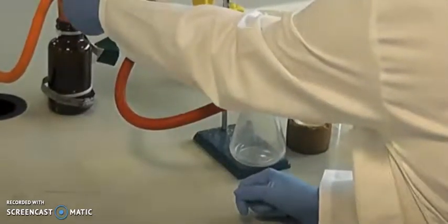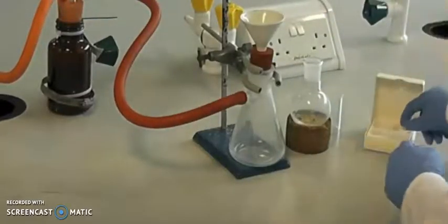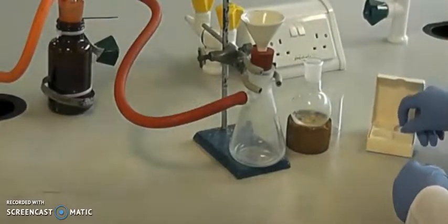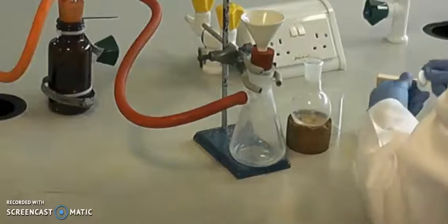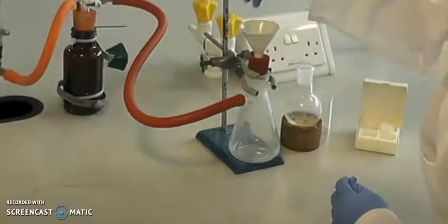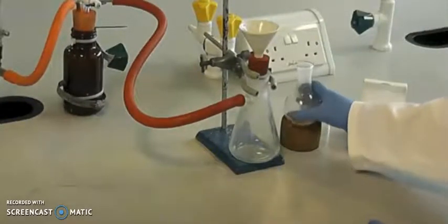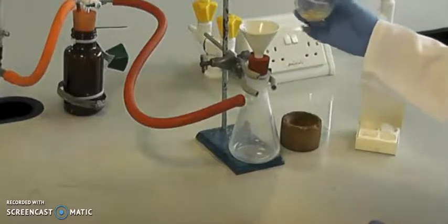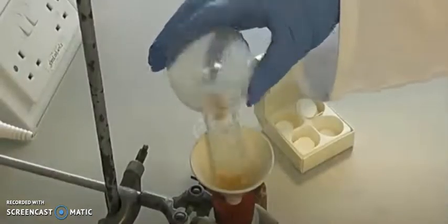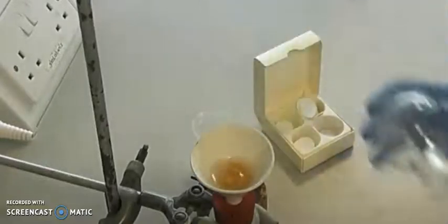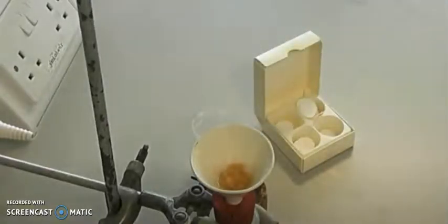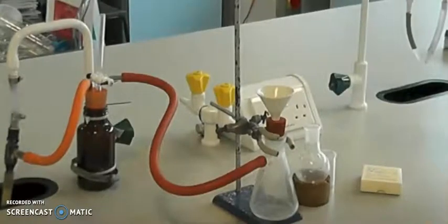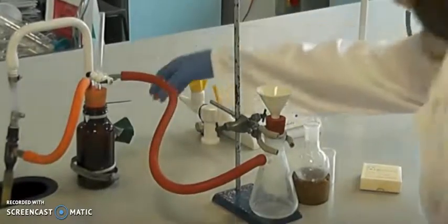Open the pressure, then put the filter paper, and then transfer. Pour the reaction mixture with the pressure. All water and any solvent will remove.